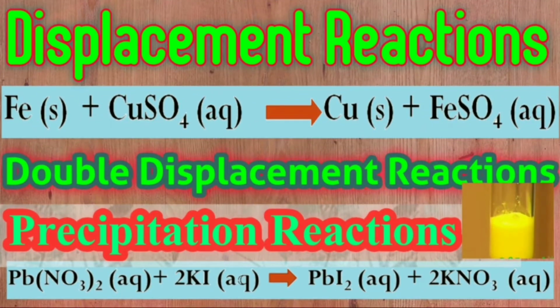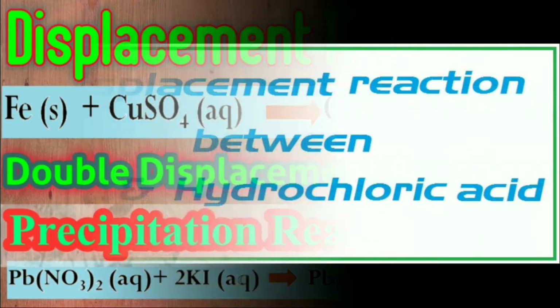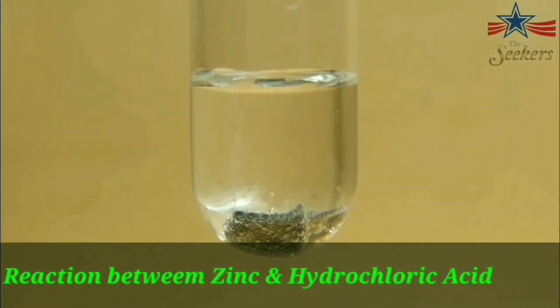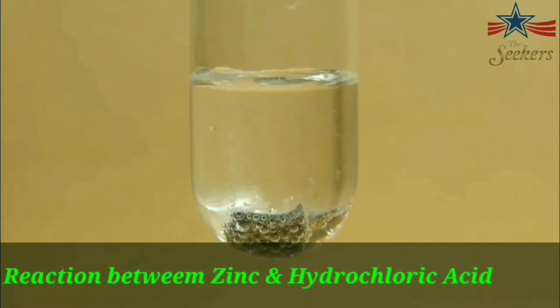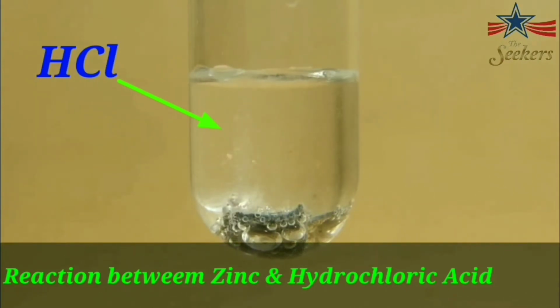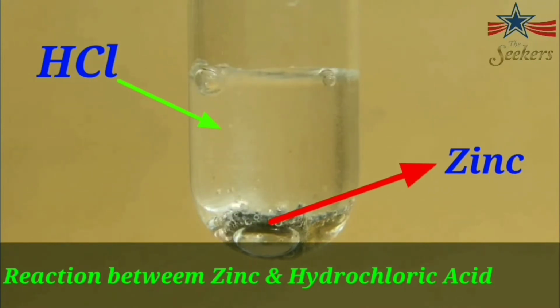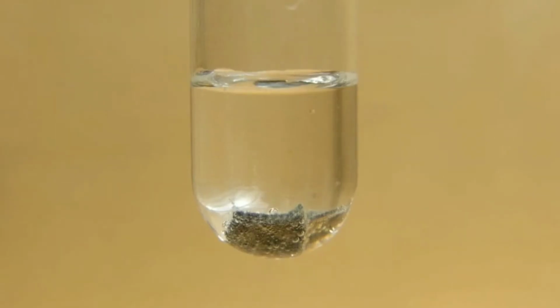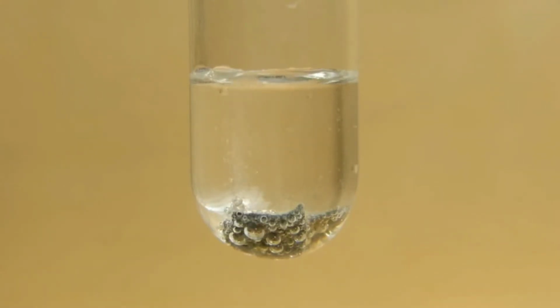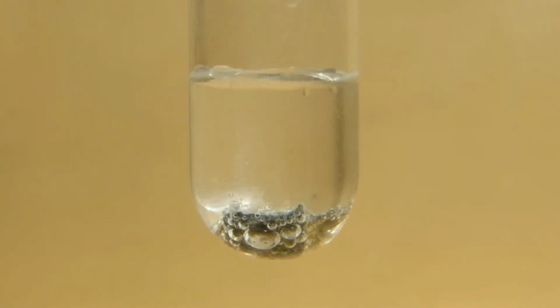In this session, we will study displacement reactions, double displacement reactions, and precipitation reactions. Let's see the video of displacement reaction taking place between zinc and hydrochloric acid. When we put some zinc granules in the test tube containing hydrochloric acid, reaction starts instantaneously and bubbles of some gas begin to evolve. Dear students, can you name the gas formed during this reaction?